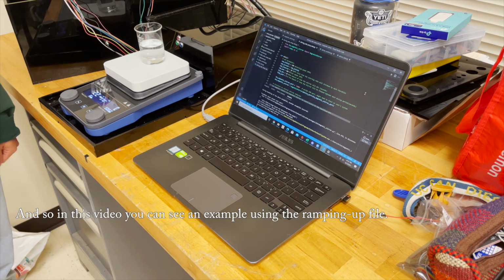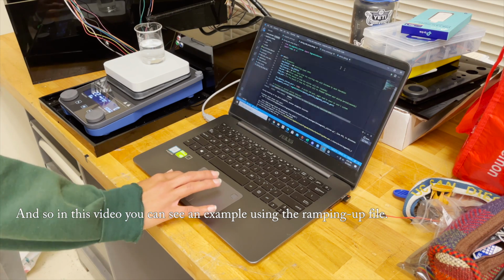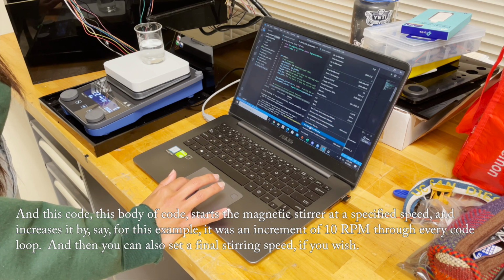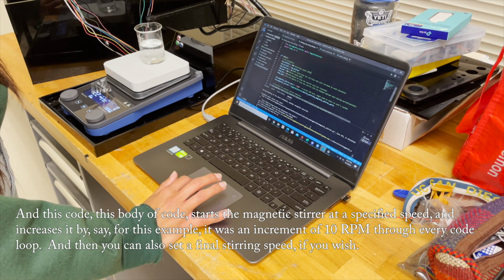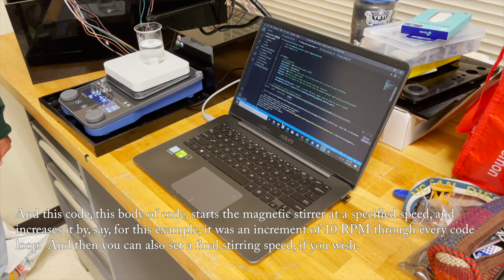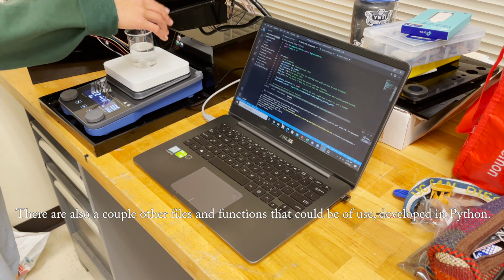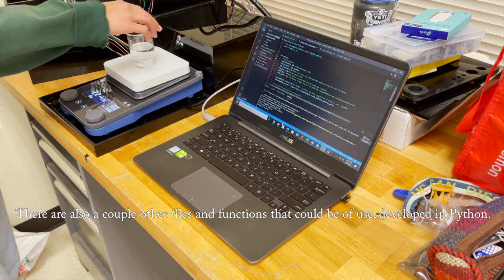And so in this video, you can see an example using the ramping up file. This body of code starts the magnetic stir at a specified speed and increases it by, for this example, an increment of 10 RPM through every code loop. And then you can also set a final stirring speed if you wish. There are also a couple other files and functions that could be of use developed in Python.